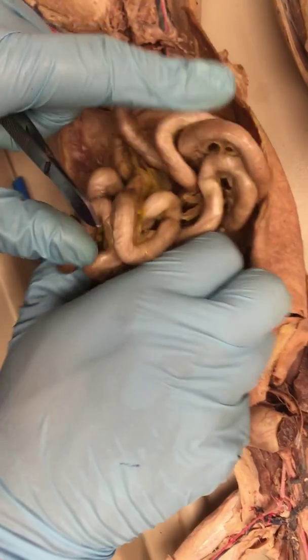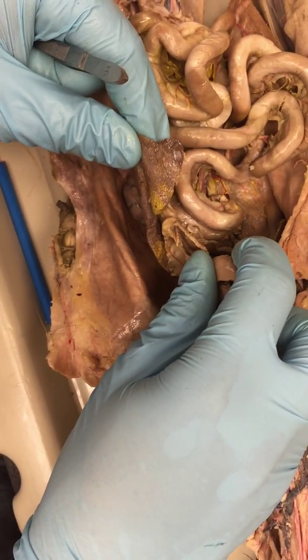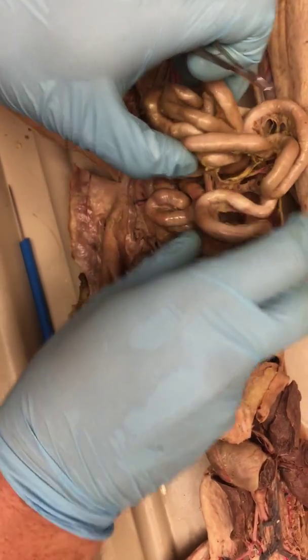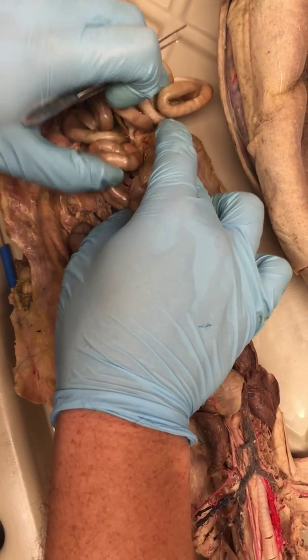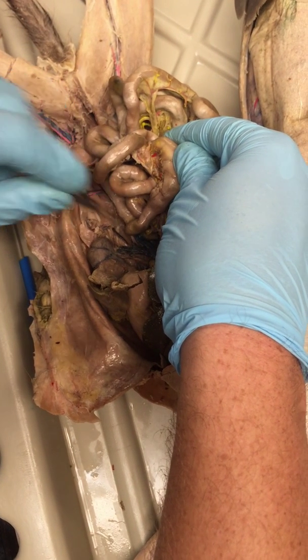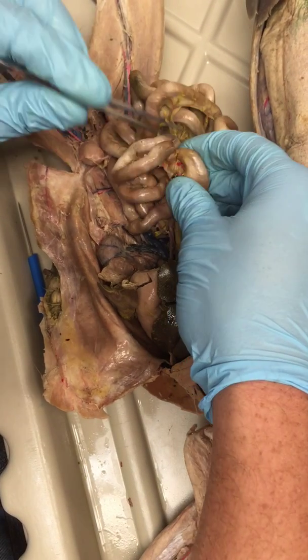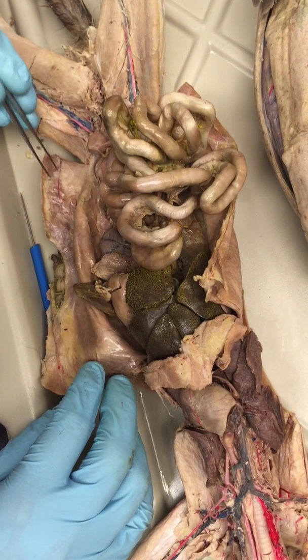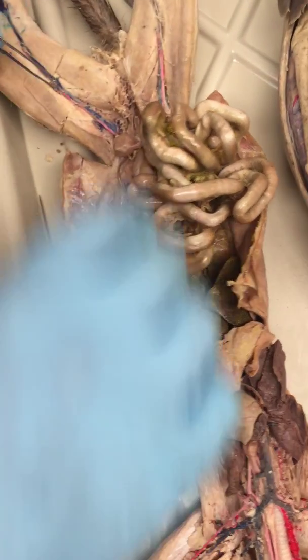Let's talk about the large intestine. Oh, I also almost forgot. This little gray structure next to the pancreas is the spleen. Okay, let's talk about the large intestine. So if we cut this out and we put it on the test, you'll see it like this, where you'll have an ascending, transverse, and descending colon. Cool. That's how it would look. And watch out, there's also the cecum up here. The cecum is used more in cellulose degradation, so you'll see it a lot in ruminants and other things that eat a lot of plants.